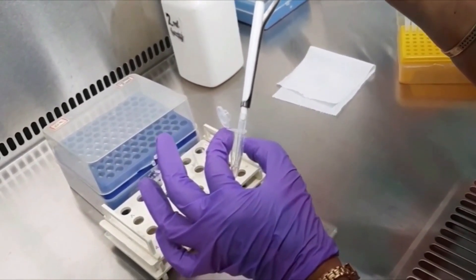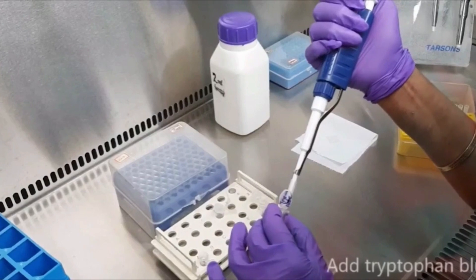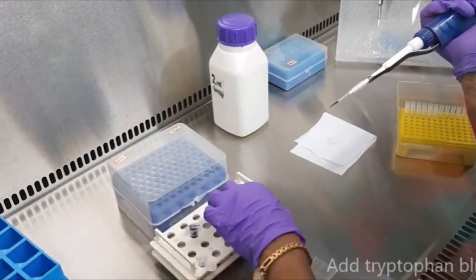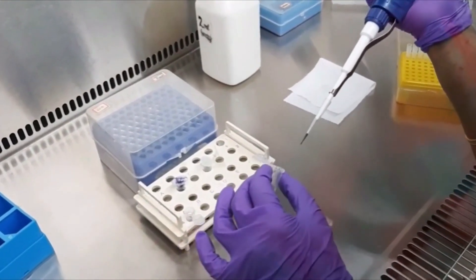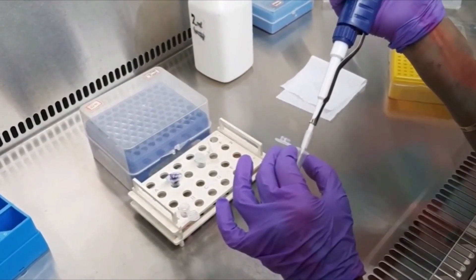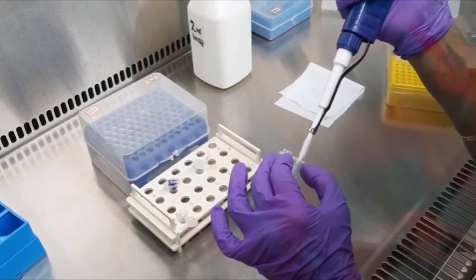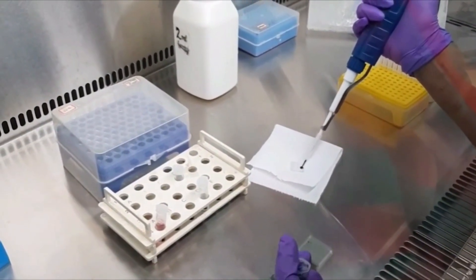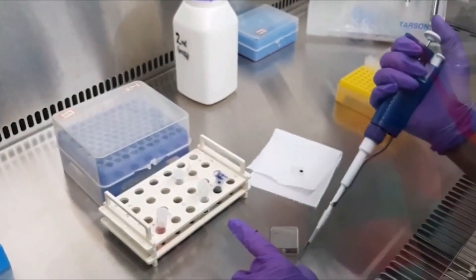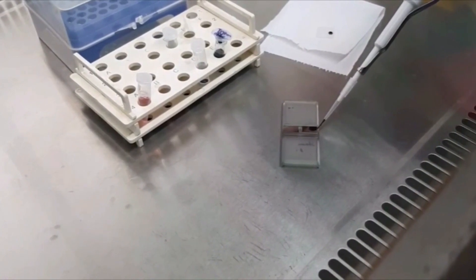After resuspending the pellet, take 20 microlitres of the cell suspension and add Trypan Blue, mixing gently. Then take about 10 microlitres of the cell suspension with Trypan Blue and insert it between the coverslip and the hemocytometer. The sample spreads evenly into the counting chamber by capillary action.